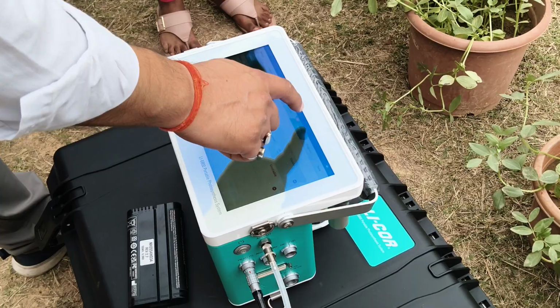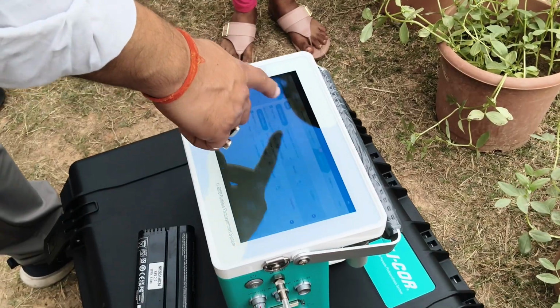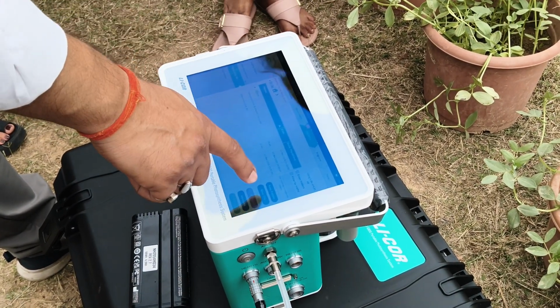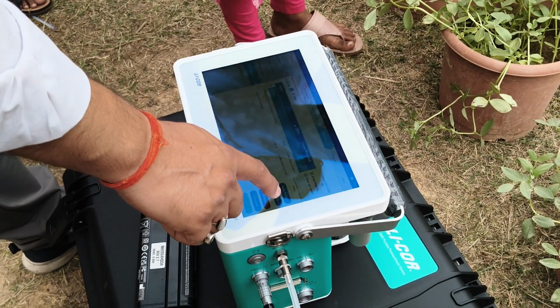Okay, then we go into the polyhouse. Stability option, you need to find whether your instrument is stable or not stable, and then you go into this, open a log file. Create a new file. First polyhouse. You have to shift this along.